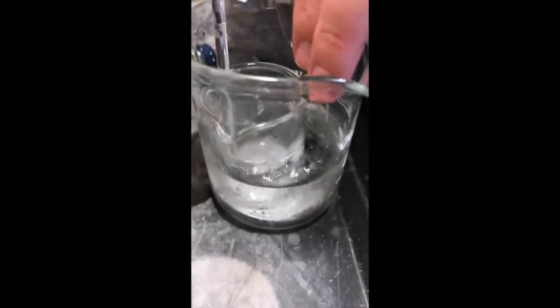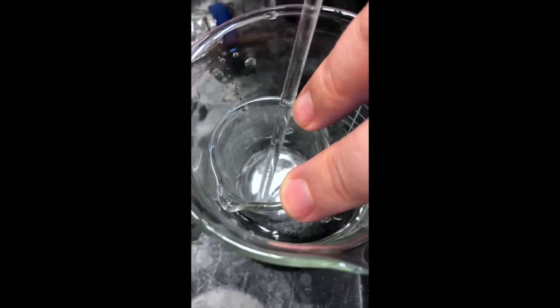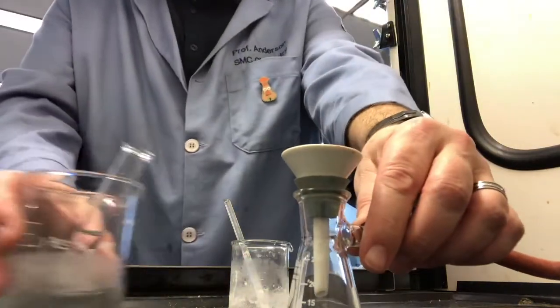Initially it was a very sticky product that only solidified on scratching with ice. In fact, at this point, you notice I broke the stirring rod while trying to scratch it. Scratching helps the crystals form rather than a liquid or oil. And you can see here eventually it did solidify enough for filtration. So once we have nice filterable solid, we can start our vacuum filtration process.